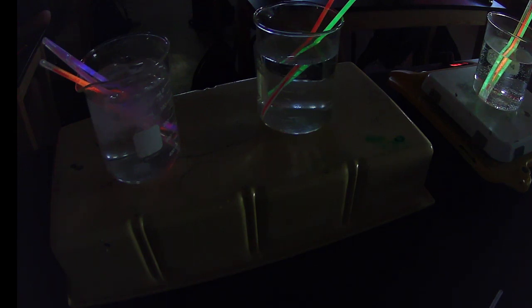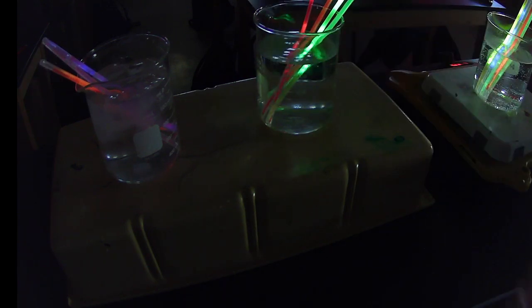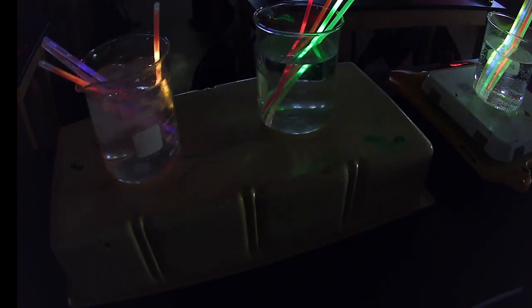As you guys are watching these, which ones are the brightest right now? Right. Because remember, we're increasing the temperature, right? These are nice. And as you can see, which ones are the lowest? Cold. Now, do you think we can reverse this process? How do you think I can make the cold ones brighter? What should I do?